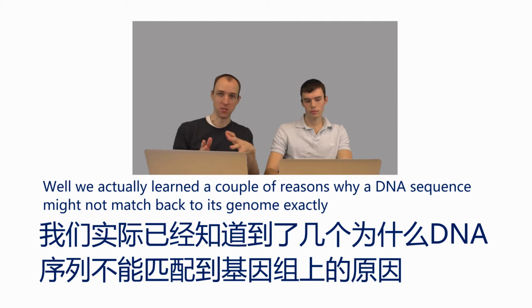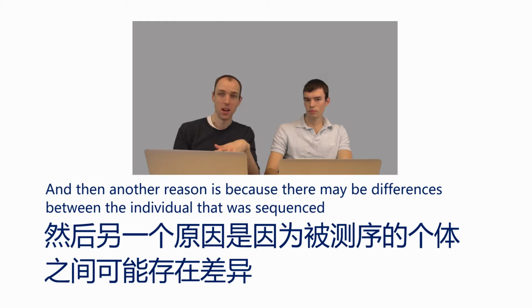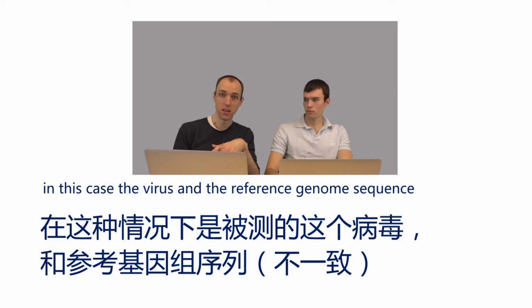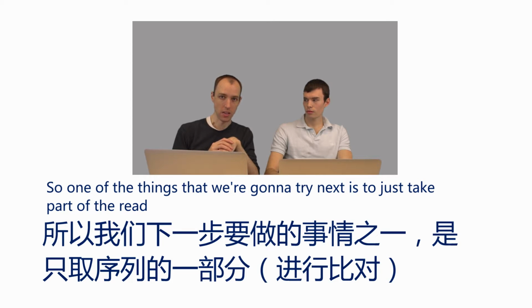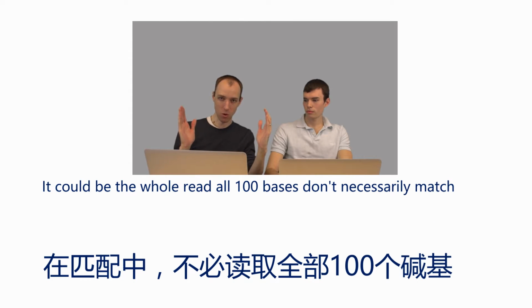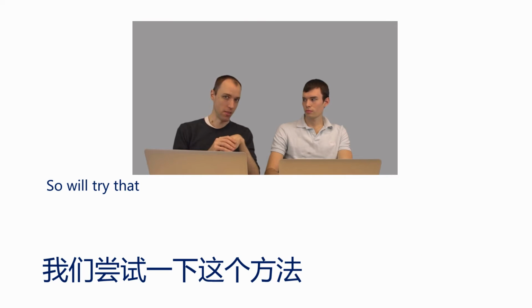Well, we actually learned a couple of reasons why a sequence obtained with a DNA sequencer might not match back to the genome exactly. One reason is because of sequencing errors. So it could be that some of the bases were read incorrectly by the sequencer. And then another reason is because there might be differences between the individual that was sequenced, in this case a virus, and the reference genome sequence. In this case, it's probably mostly the sequencing errors that are the reason why many of these reads are not aligning. So one of the things that we're going to try next is to just take part of the read. It could be that the whole read, all 100 bases, don't necessarily match, but if we just take a piece, like maybe the first 30 bases or so, that has a greater chance of matching exactly. So we'll try that next.